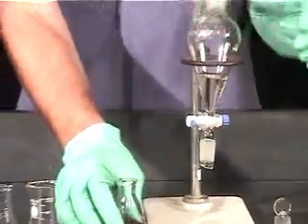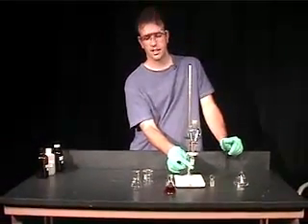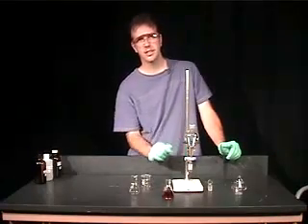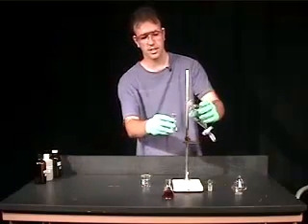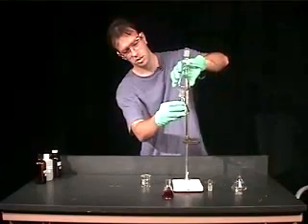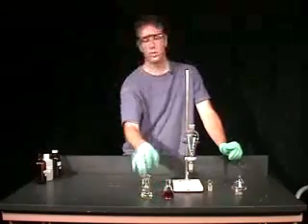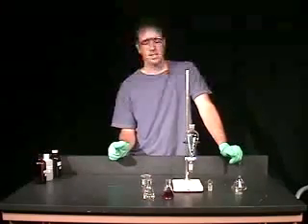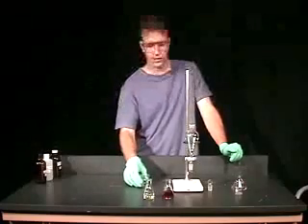We don't want to pour the ethyl acetate through the stopcock, because if we did that, we would contaminate it with a little bit of water that's still present in the stopcock. So the top layer always goes out the top of the separatory funnel. As you can see, some of the color was transferred to the ethyl acetate layer. Typically in an extraction like this, you're going to do 2 or 3 extractions. You'll simply have to follow your procedure, which is given to you in the lab.